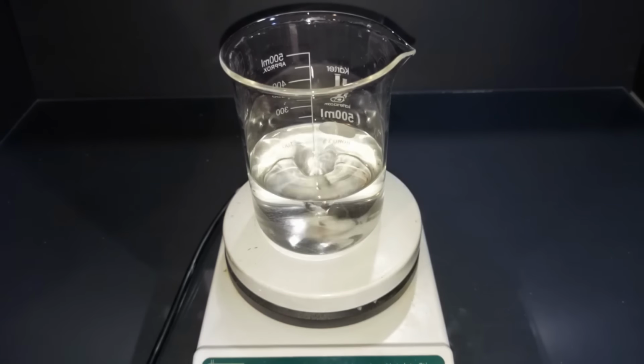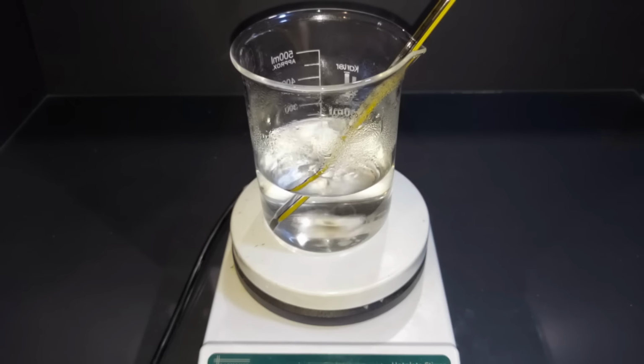Adding the potassium hydroxide to the oxalic acid solution. The solution turned out to be nice and clear, which is great. The exothermic reaction we just did brought the temperature up to 78 degrees Celsius. When that actually starts to cool down, I know that the reaction itself is completed or has taken place, and then I'll start to externally heat it with the hot plate until we get rid of half the volume, approximately down to about 100 milliliters.